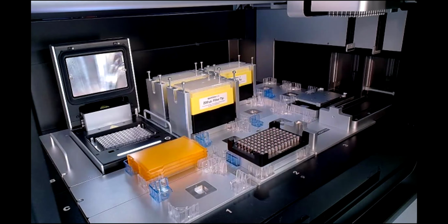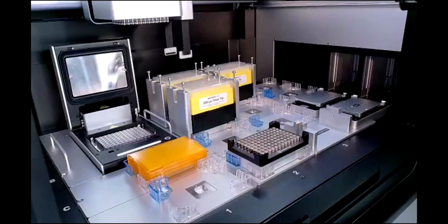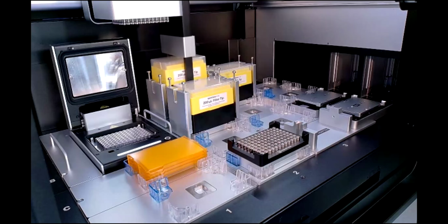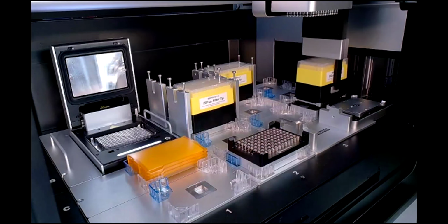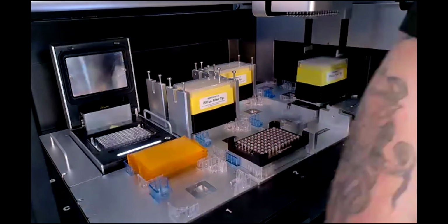And in that, I'll probably let this continue to run in the background as it continues to loop, and now you can see it start to put back the tip racks. But I will also kick it over to Fran, who can start the moderation process if we have any questions coming in. And Matt, I'll invite you to come back over here with me, and I'll move this other camera out of the way.